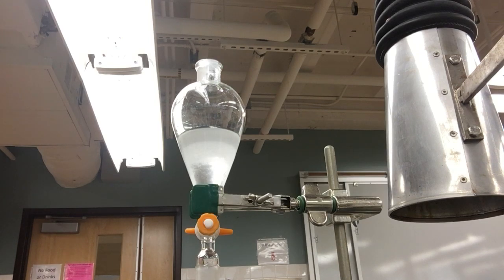Once they separate, we will discard the bottom layer which is aqueous and keep the top layer which is organic, which is a mixture of 1 and 2 hexanol.